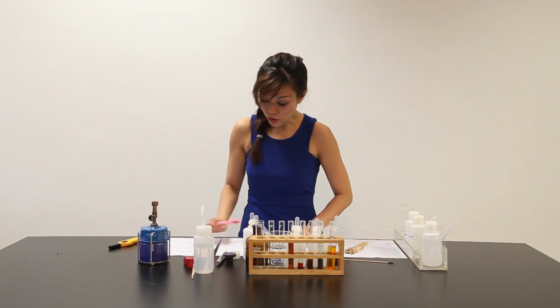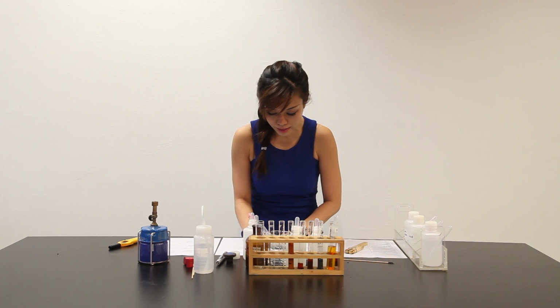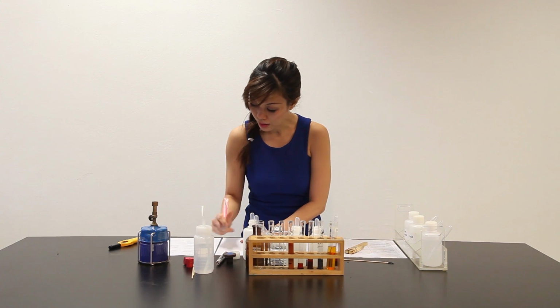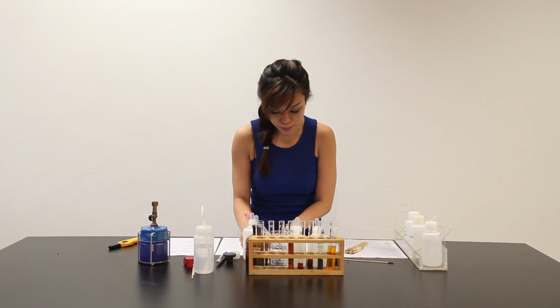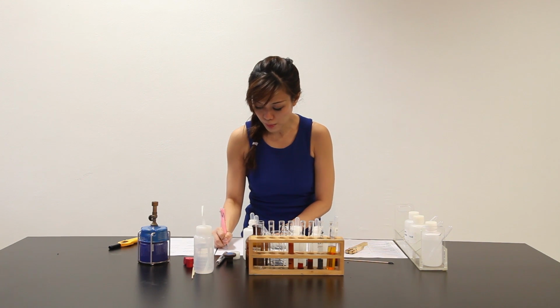Well, according to my QA notes, if silver nitrate gives a white PPT, I can conclude that salt X contains chloride. Evidence, part C, part 3, when silver nitrate is added, white PPT is observed.